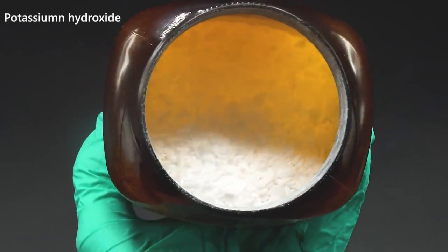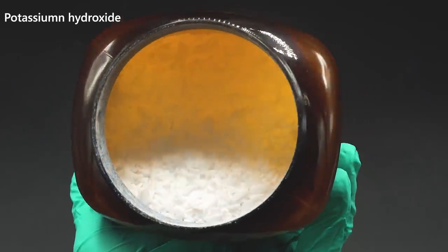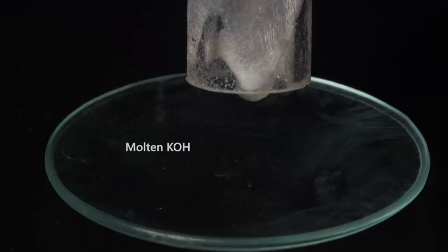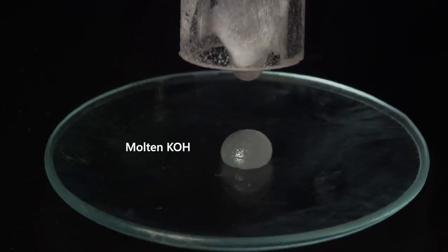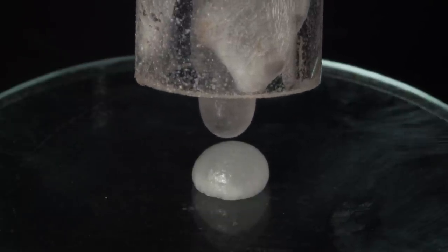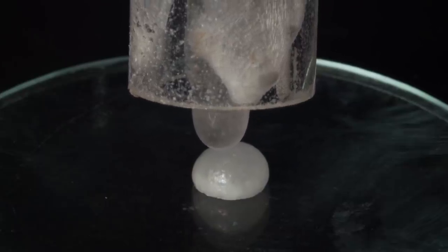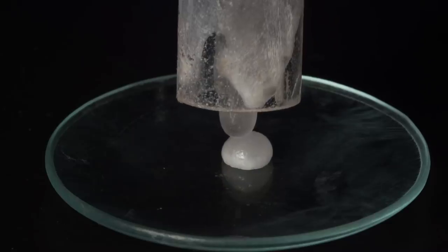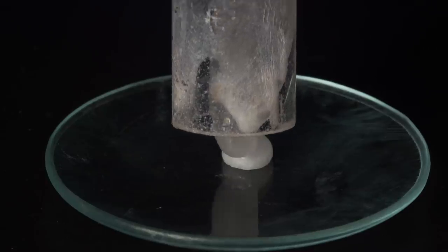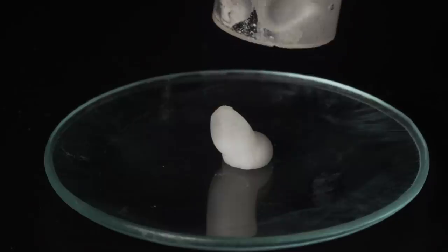Potassium ozonide can be prepared at low temperatures by ozone treatment of dry potassium hydroxide. To get potassium ozonide in this reaction, I will use potassium hydroxide, and I will melt it to remove water as much as possible. Potassium hydroxide must be cooled down to room temperature or lower before the reaction.